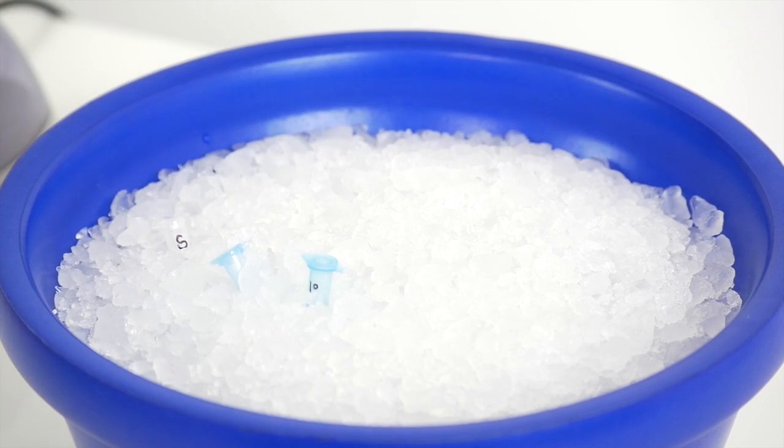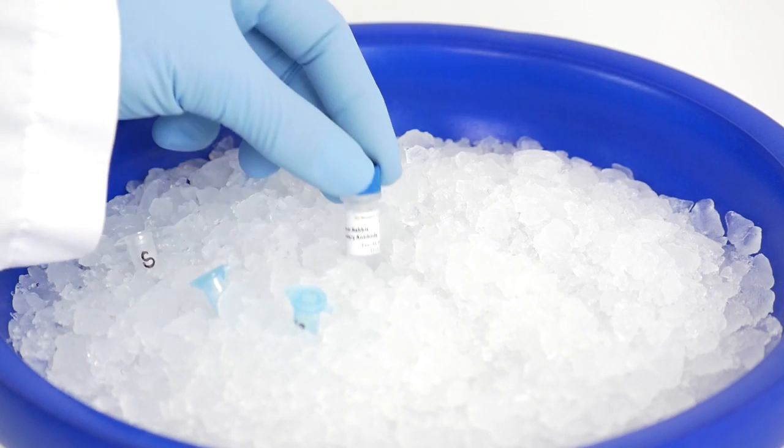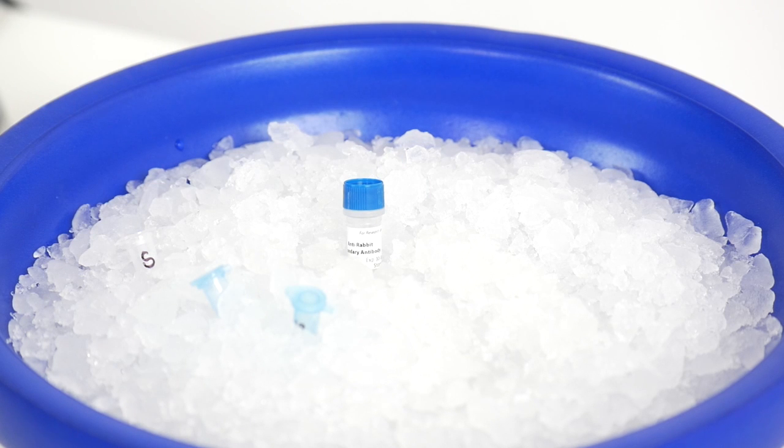You have the option of using your own secondary antibody. But if you have questions, you can contact us at support at ProteinSimple.com or check out our antibody database on the ProteinSimple website.